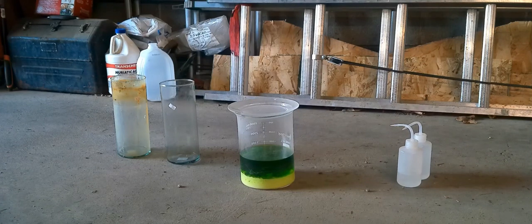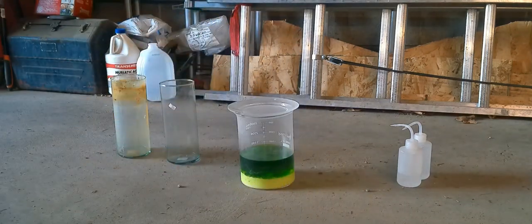You can see my setup here for the next step in this process. I've got some distilled water and the squirters over there. I have our precipitated silver with the muriatic acid — you can see it in the bottom — and then the remaining acid with probably some copper in the top. I'm going to rinse that out and will probably do 15 to 20 rinses to get it nice and clean before we move on to the next step, which is why I have a gallon of distilled water here.